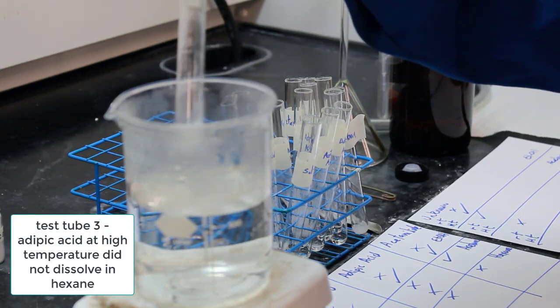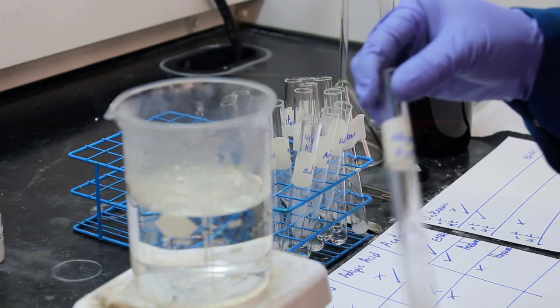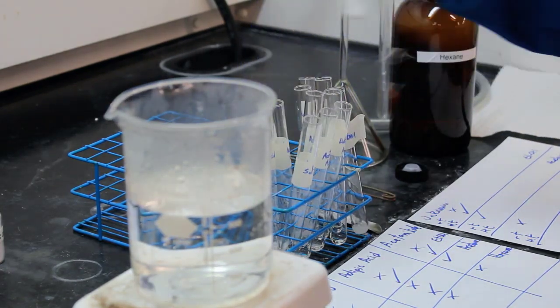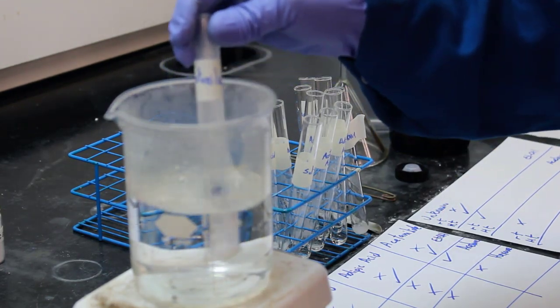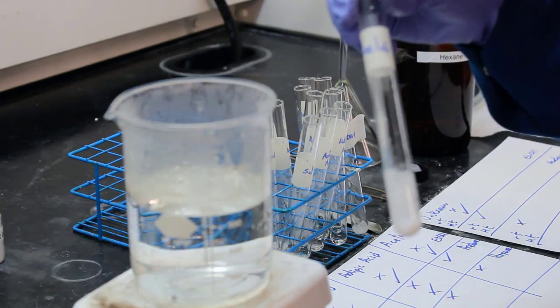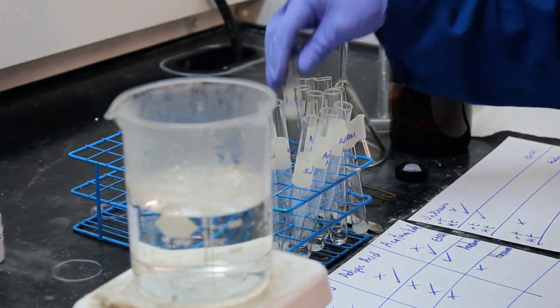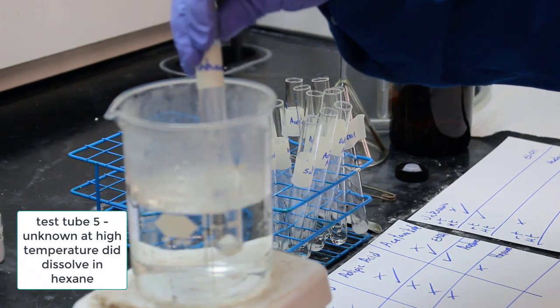Adipic acid does not appear to be dissolving at high temperature in hexane. Acetanilide, also not dissolving in hexane at high temperature. Man. All right, what about our unknown?